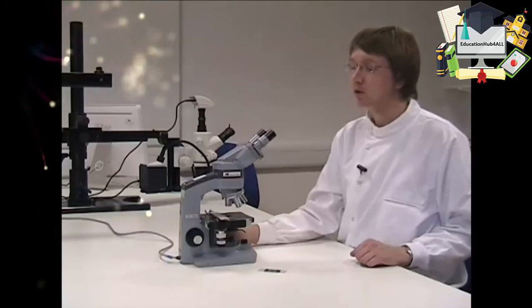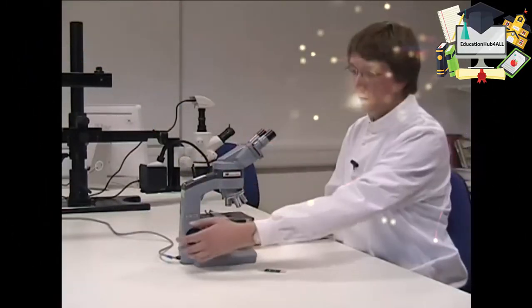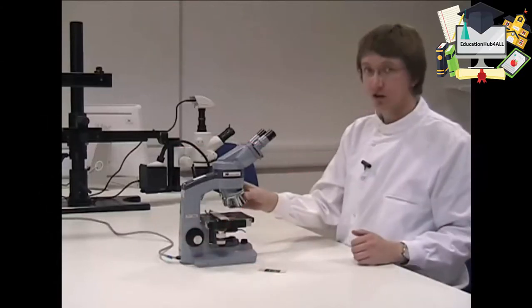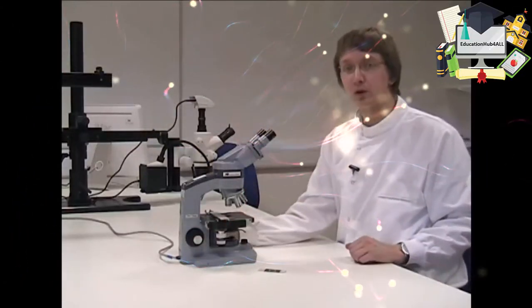By the end of the video you should know how to properly adjust the eyepieces, how to adjust the focus and the magnification, and also how to set up the illumination system to give you the best view of your slide.